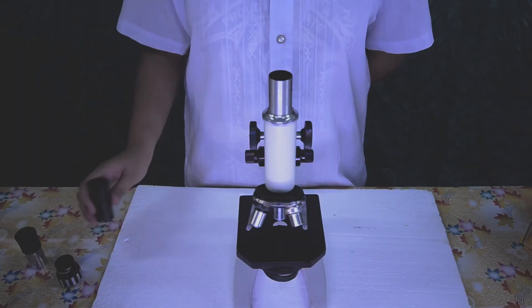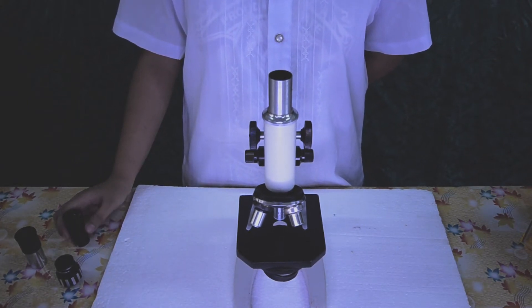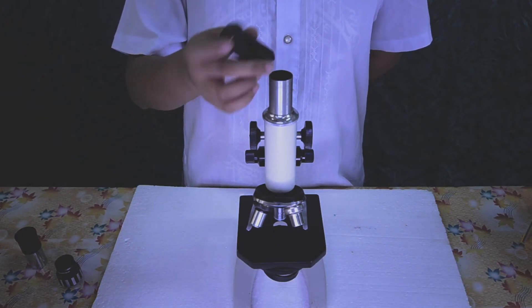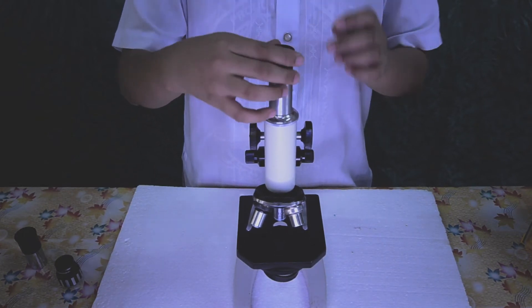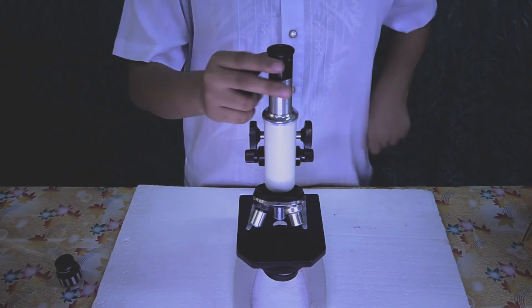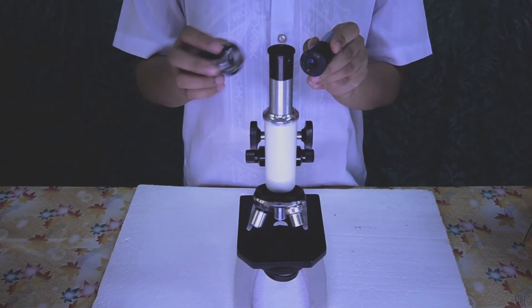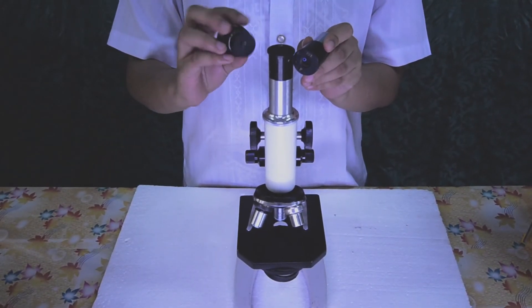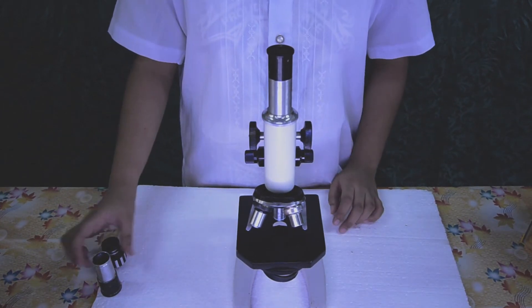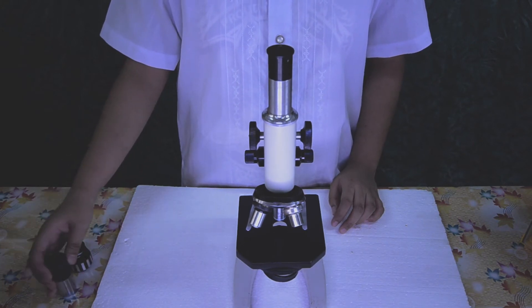The second part is the optical part that is used to enlarge the specimen. Eyepiece or ocular. It is a lens fitted at the top of the body tube. It is always marked with a number — 5 times, 10 times, 15 times — on its ring. This number shows its magnification power. The magnified image of the object is seen with the eyepiece.